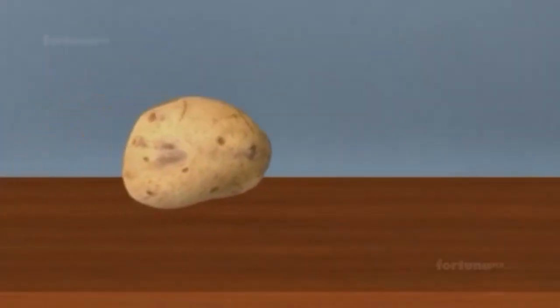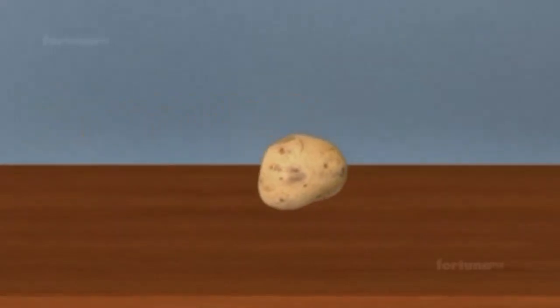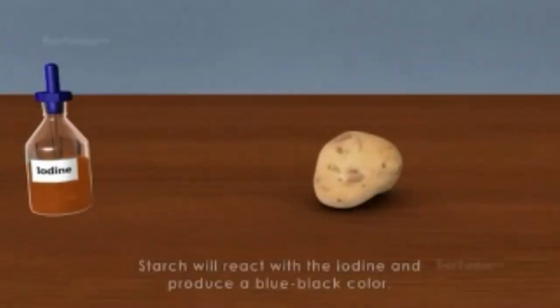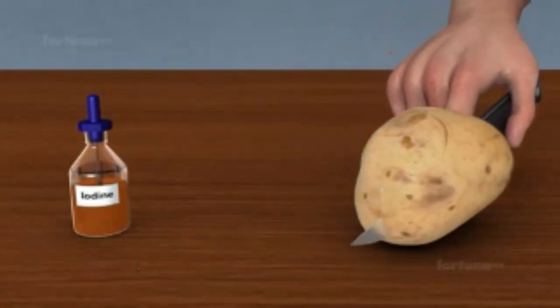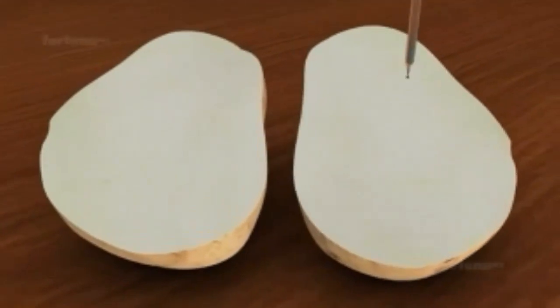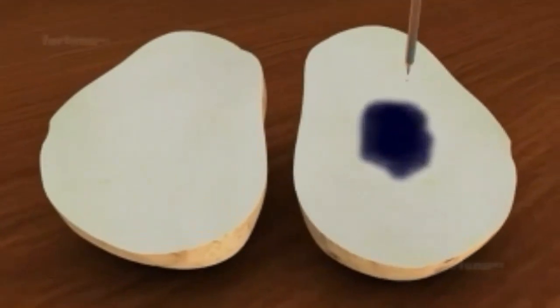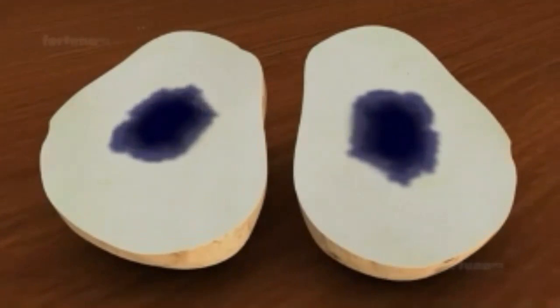Let's do a simple test to check for the presence of carbohydrates in a potato. The principle behind this test is that starch will react with the iodine and produce a blue-black color. Begin by cutting a raw potato in half. Using a dropper, add 2 or 3 drops of a dilute iodine solution on the interior surface of each half. You'll soon notice a bluish-black color at the place where you dropped iodine. This test confirms that a potato does have carbohydrates.